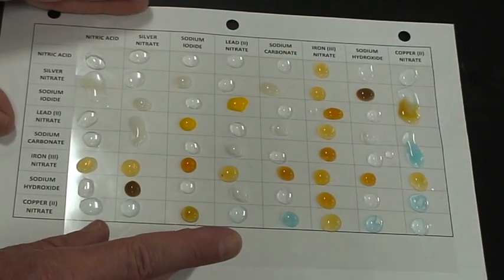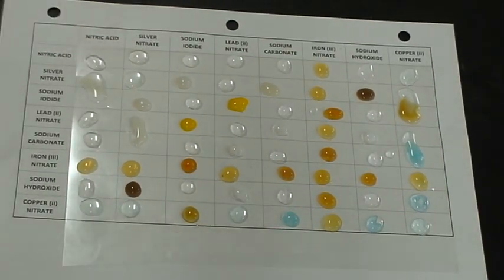Okay, so just setting the stage for this in chemistry, it's one thing to know if something actually did react, what it reacted with as a chemical property, but also we use it as a fingerprint. So now we're going to be mixing some 7 unknowns with these 8 solutions. Okay, and so what you're going to do is you're going to figure out what are these things based on this qualitative data.